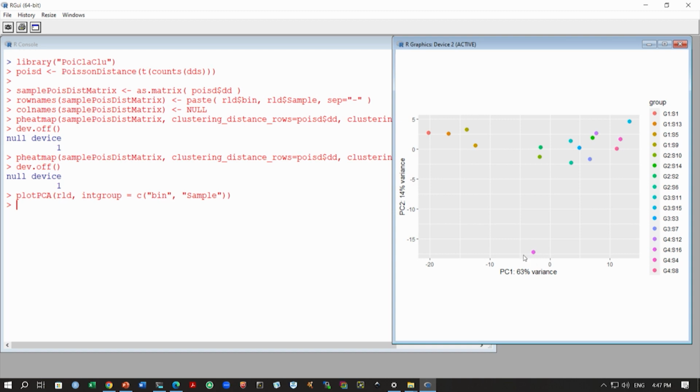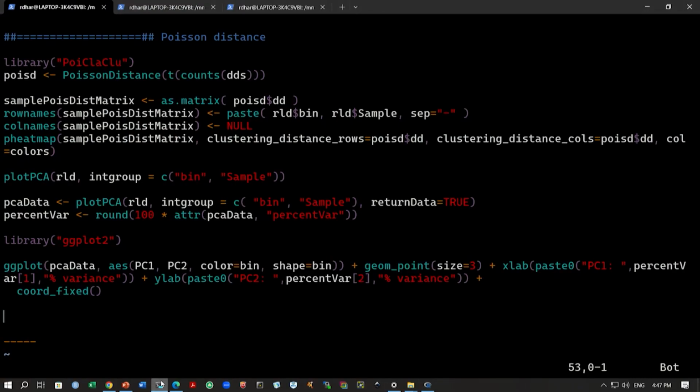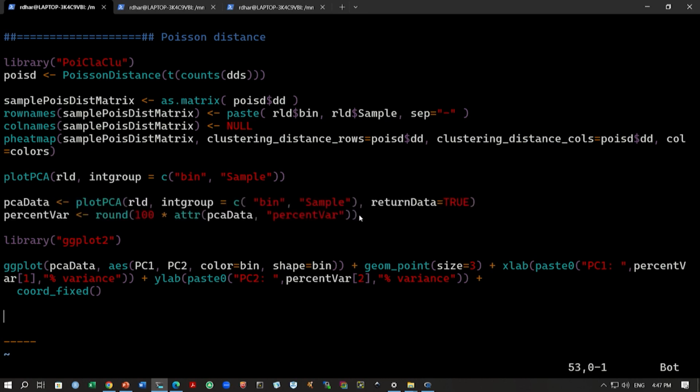So, from all this analysis, it is clear that we should perhaps discard S16 from our analysis, because it looks like an outlier. So, this is something we can do, and we can come to this conclusion based on these two different preliminary analyses. We can also do this slightly differently. We can generate this PCA data, calculate this percent variance, and use the ggplot library to also plot the PCA data.